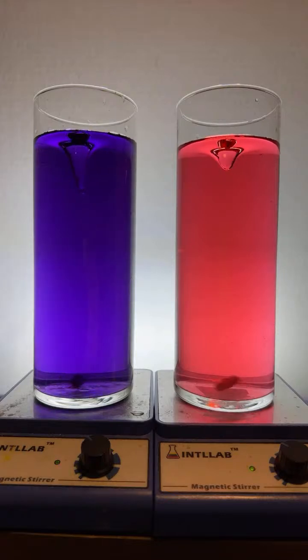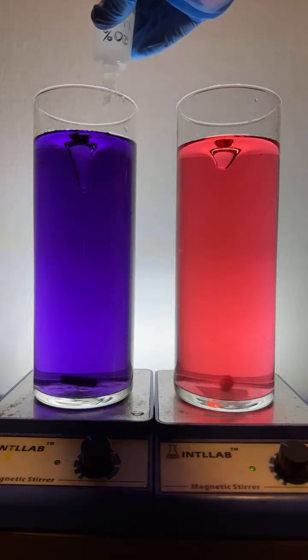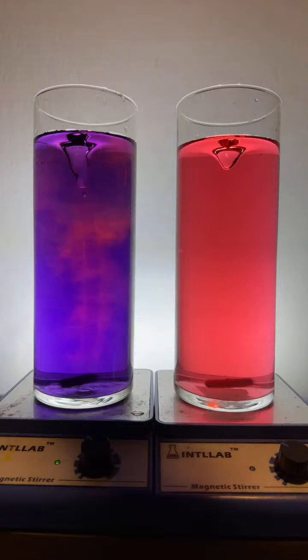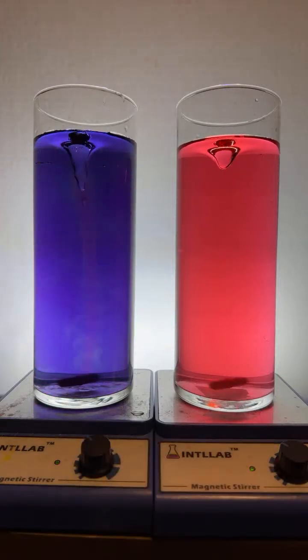I got you a flash of green. Here, let's add a bunch of acid over here on the left. Here we go. Drops of acid, 1. It's like the daylight breaking through the dark violet of night.